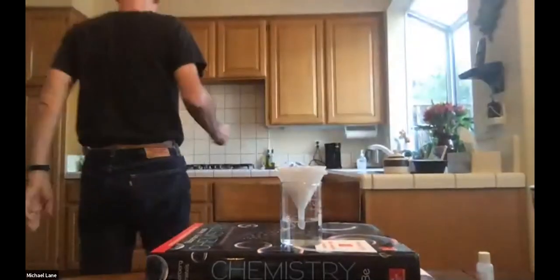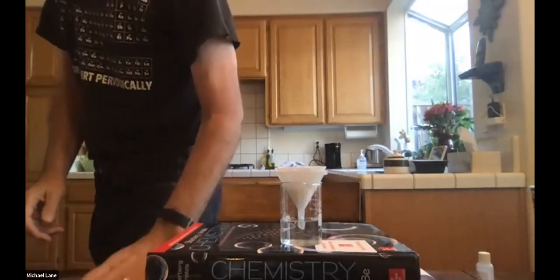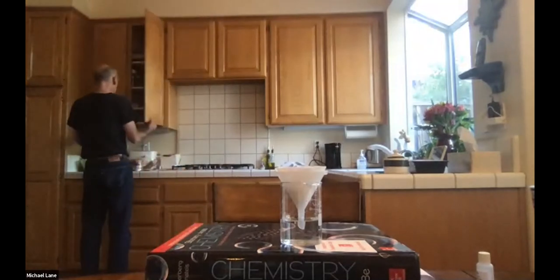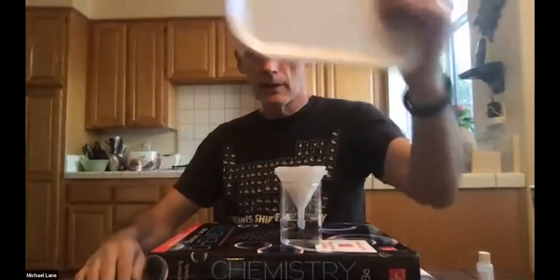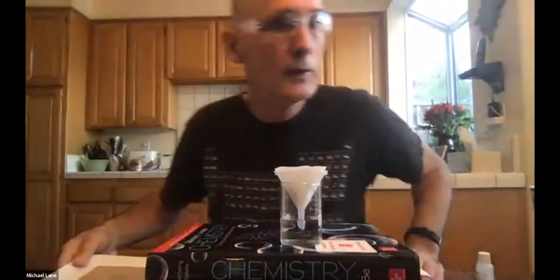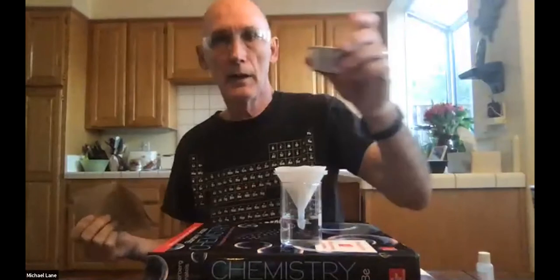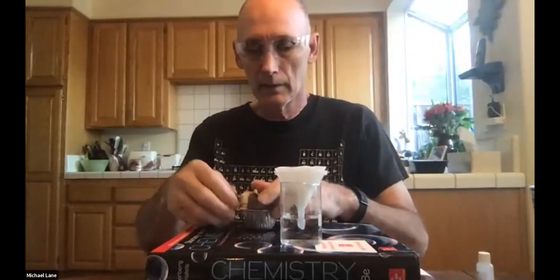Now, while that's getting set up, I'm going to get myself a paper towel. I've got my paper towel. I'm going to get myself a small plate. So you can see I've got myself a small plate. I recommend that you get a piece of glassware or perhaps something that you don't actually, you know what? Never mind that. It would really be bad form for me to suggest to you that you use kitchen glassware in a chemistry lab, even if the risk is tiny. So I'm going to use one of these cups that we've seen before and just a paper towel or some such thing. It really doesn't make too much difference. I'm going to set that aside.